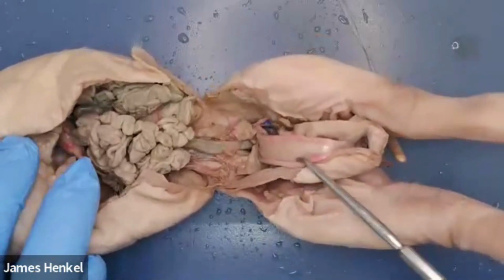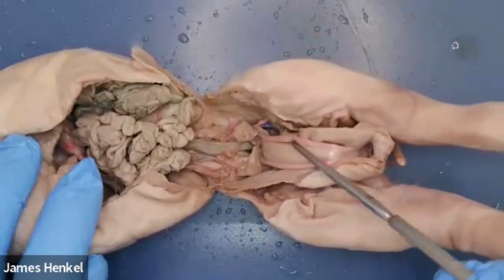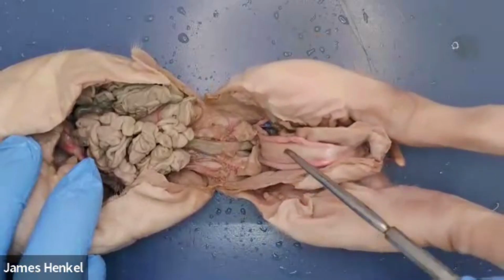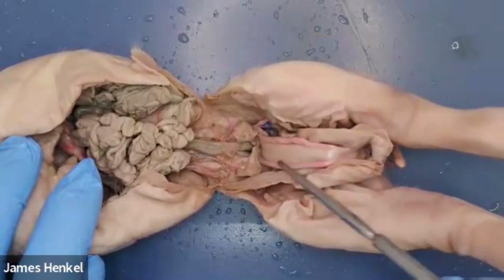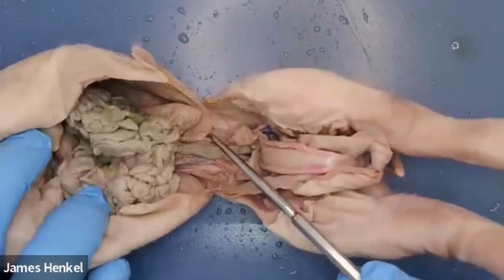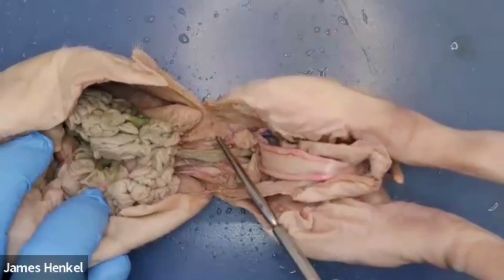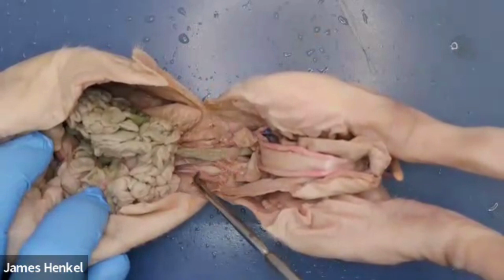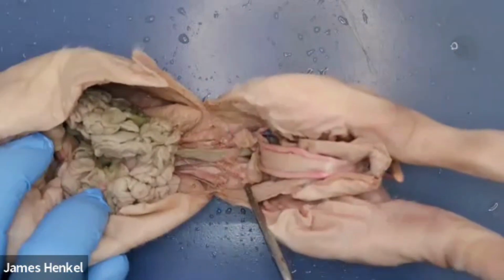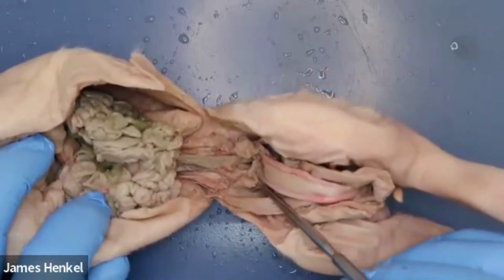Good morning. What we are looking at here is the female reproductive organs. And just to give you some reference, those are the two umbilical arteries that bracket or run parallel to the bladder there. To give you more points of reference before we begin, there's the kidney on the left side, and that is the ureter, and we have it mirrored on both sides. So the right has the ureter and the kidney as well. Then we see these two lumps that are mirrored on either side.